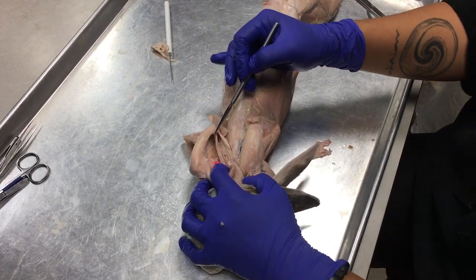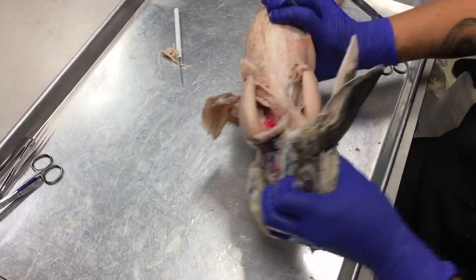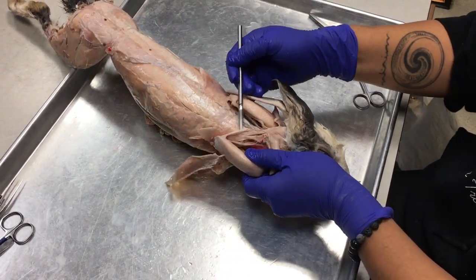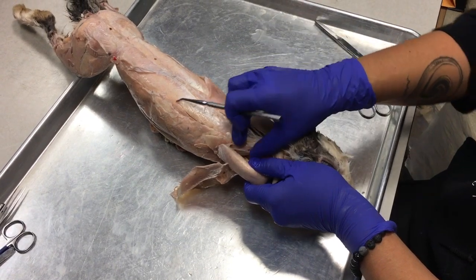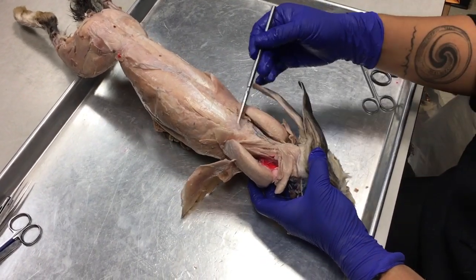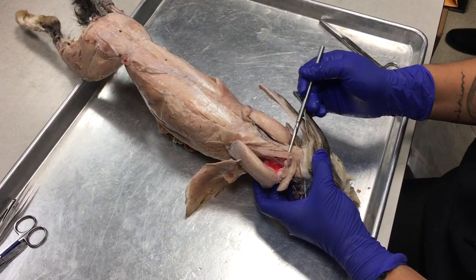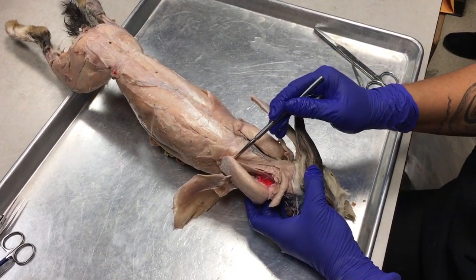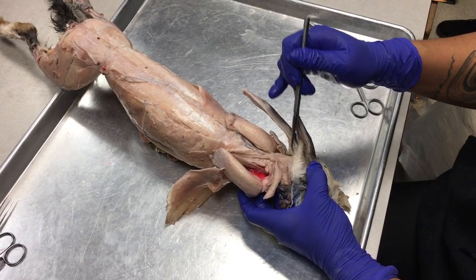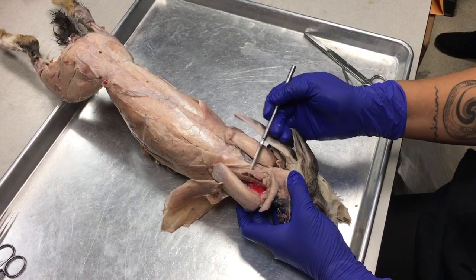Huh? Pretty easy. Okay, and if you look, the shoulder blade is attached to the rest of the body by these thin muscle fibers here. Okay, these muscle groups that are attaching the scapula to the spine are called the rhomboideus muscles. Okay, there's one rogue rhomboideus muscle that extends from the rhomboid group all the way underneath the clavodeltoid up to the head or the cap. Okay, so you wear a cap on your head. This is called the rhomboideus capitis muscle.